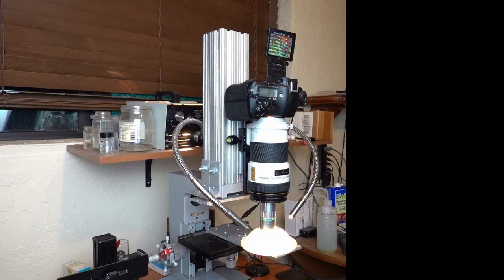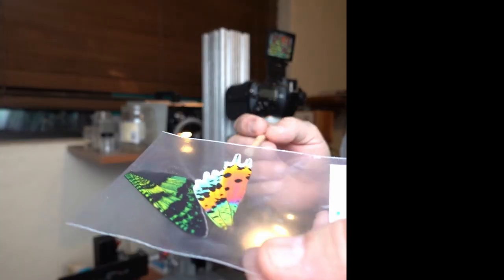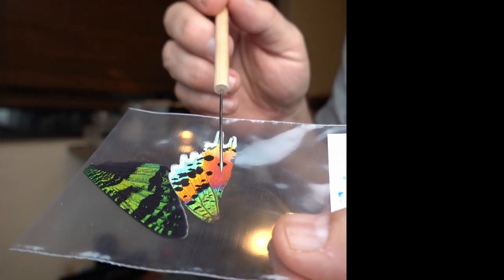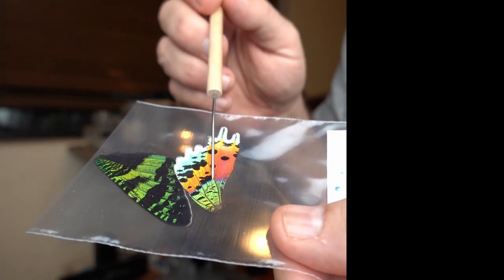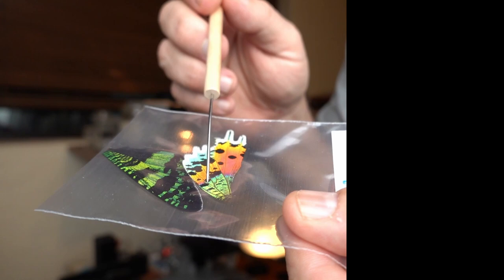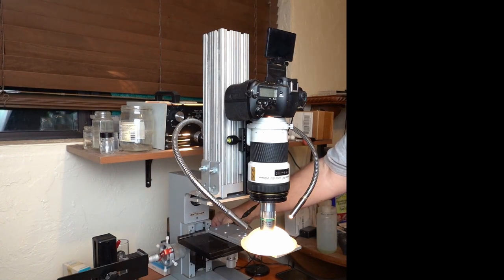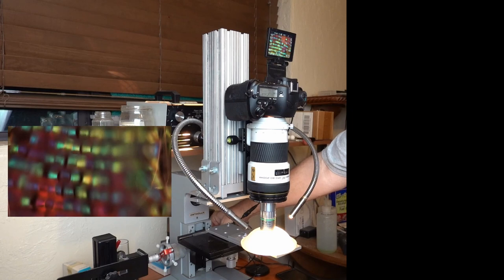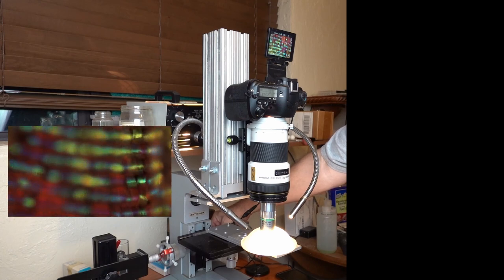Here's the system ready to take some automated stacked images. I've got a piece of Madagascan Sunset Moth wing in there, and I'll be looking at like a 1.8 millimeter section of it. So this is the underside of the top wing, and I'm kind of concentrating on these locations here. I don't know if you can see it, but there you get mixed colors of scales in there. Here, I'm going to roll the focus and you'll be able to see it on the inset image. You can see this is at 20 power. What a mess it is. The plane of focus is so thin and it shows why you need to do stacking.